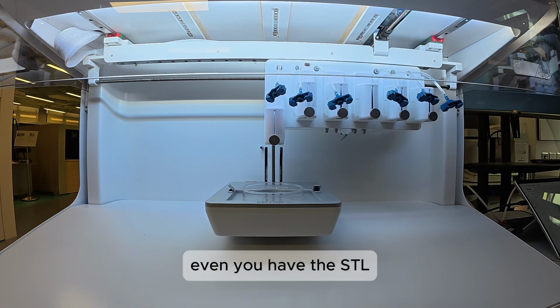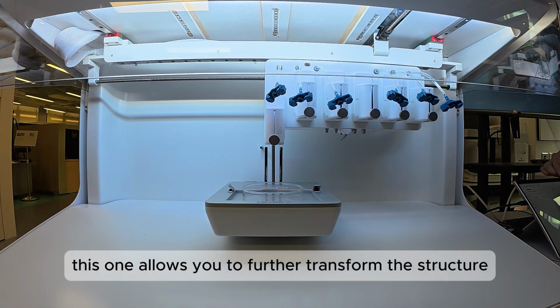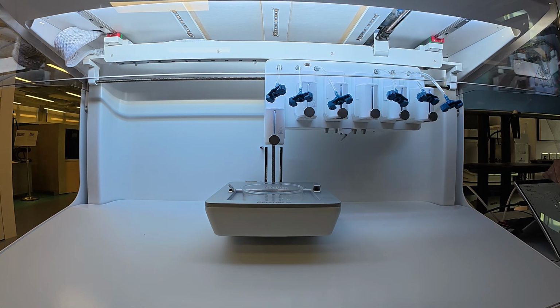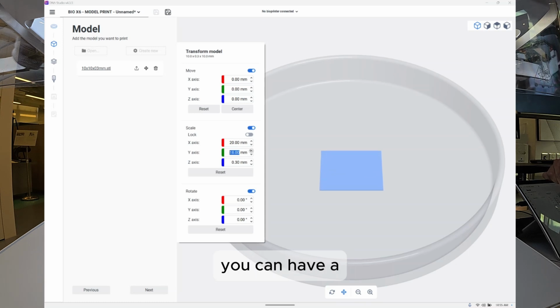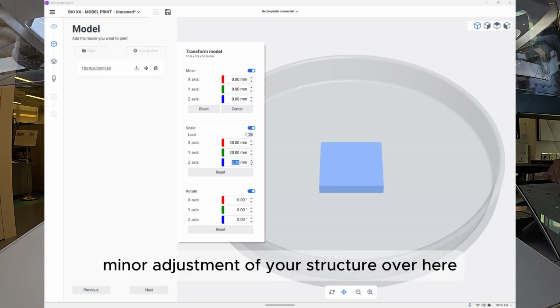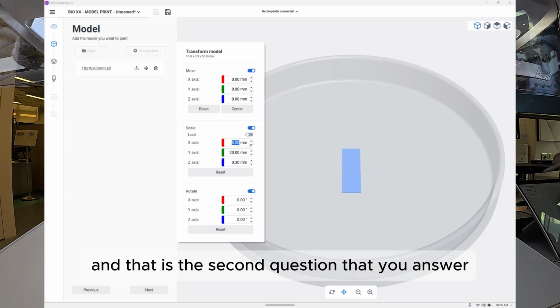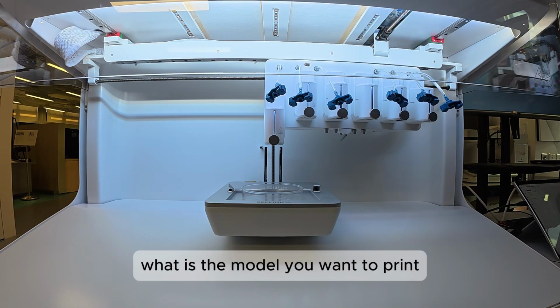Even if you have the STL, the structure is already fixed, but this allows you to further transform the structure you want. For example, you can make it bigger, or if you don't want to lock the proportions and just want the Y to be bigger, it can be done. So you can make minor adjustments to your structure here if you like. That is the second question: what is the model you want to print?